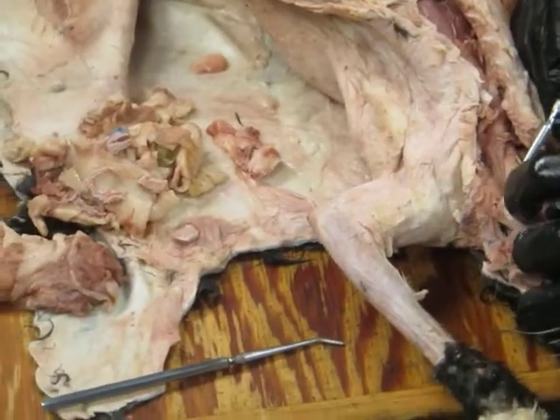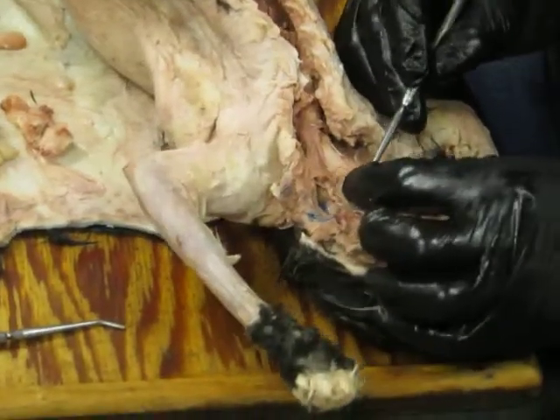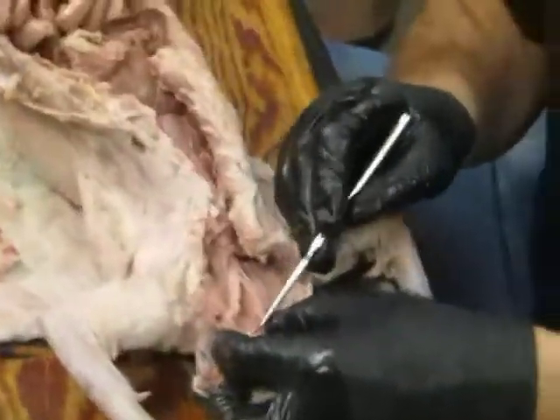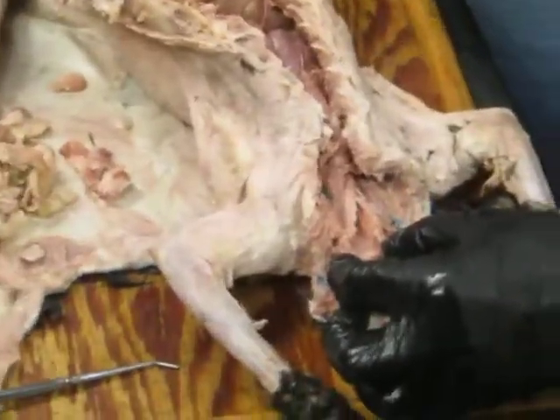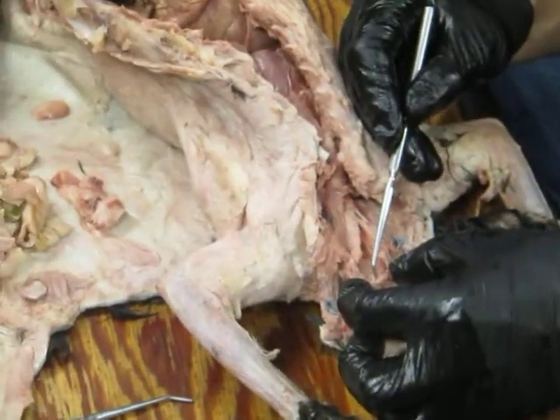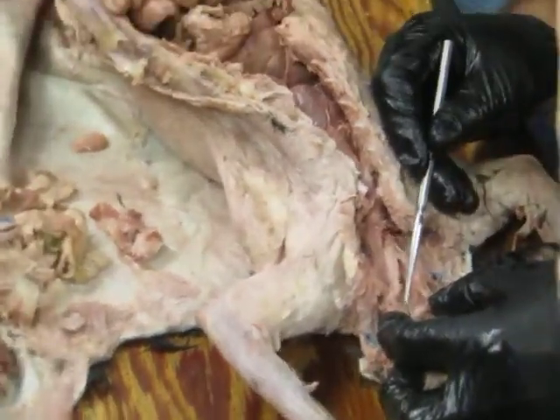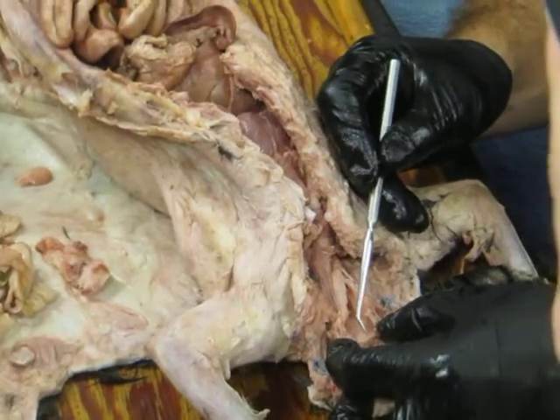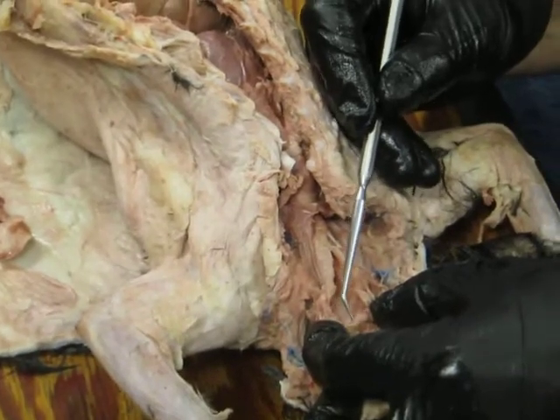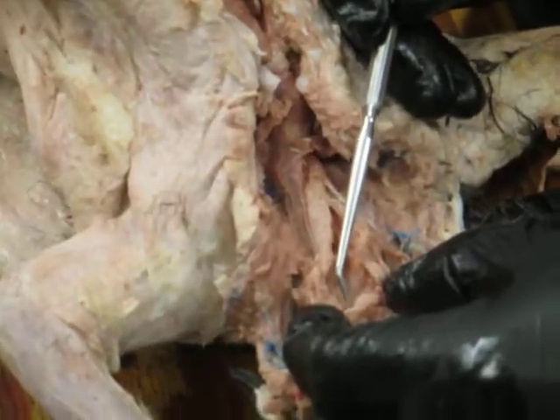But if we open up the larynx, the main thing I want to show you guys is, let me find a good view of it here. Right below the epiglottis here, there's a fold of tissue running across. And then there's a little groove below it. So can you see this here? It's very small. That fold, then there's a groove, and then another fold. And this top fold is called the false vocal fold, and the bottom or caudal fold is the true vocal fold, the vocal cord. So right there is the vocal cord.